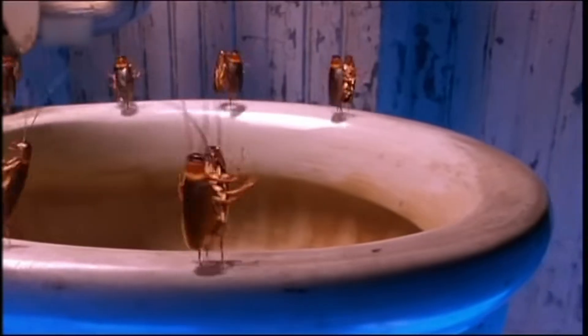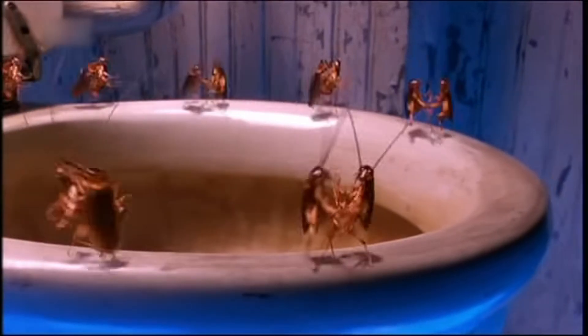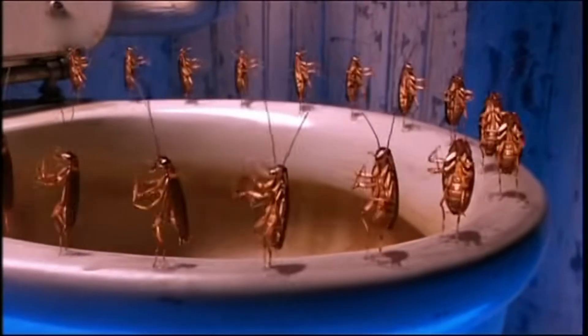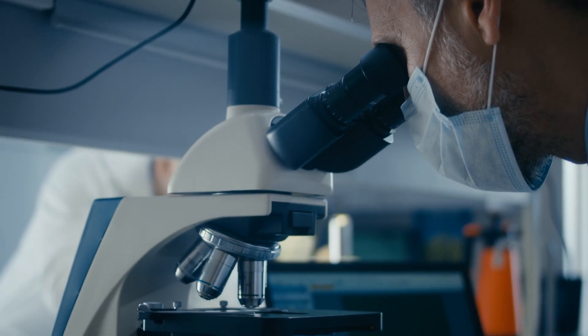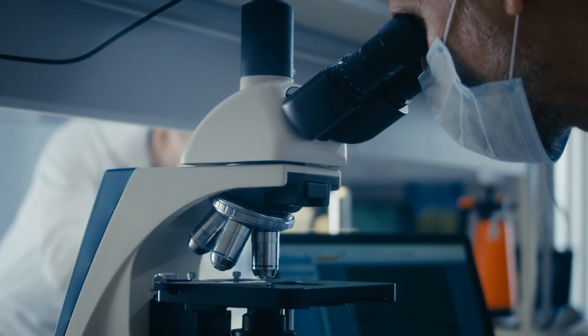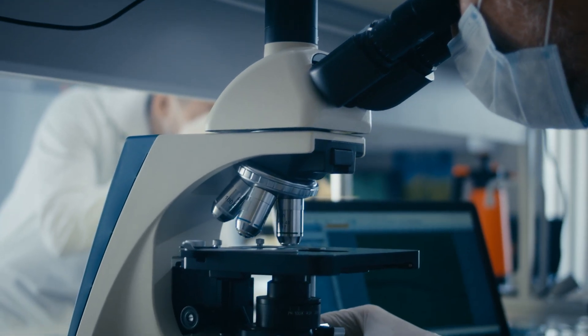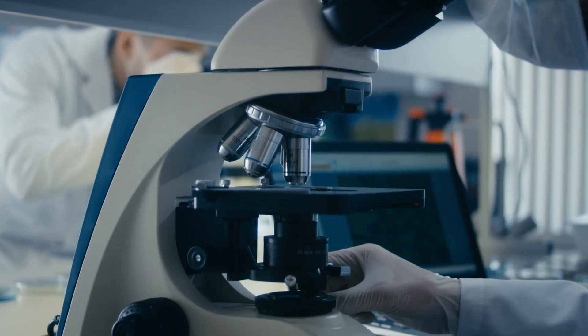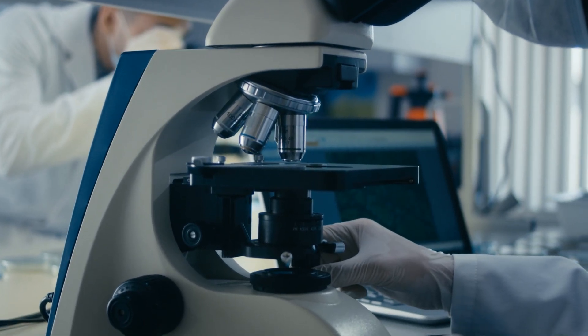Toothbrushes, razors, combs, face towels, toothpaste cups — and when you put them under a microscope, you'll see a hidden microbial world lurking within your daily routines.